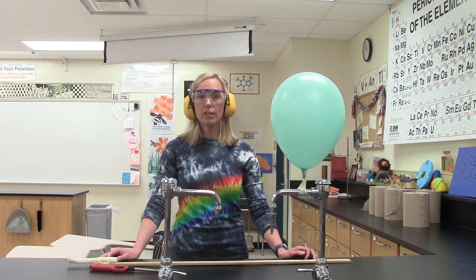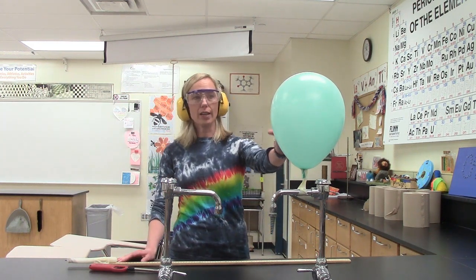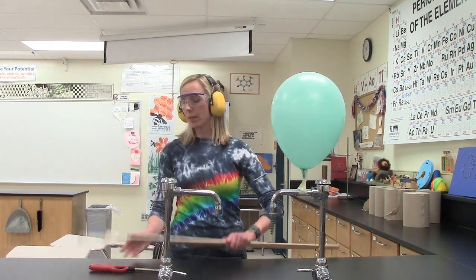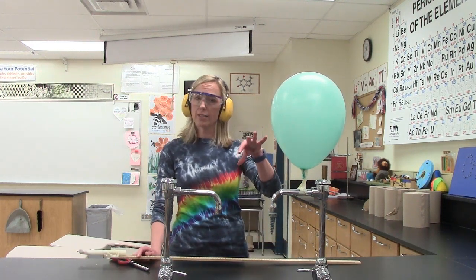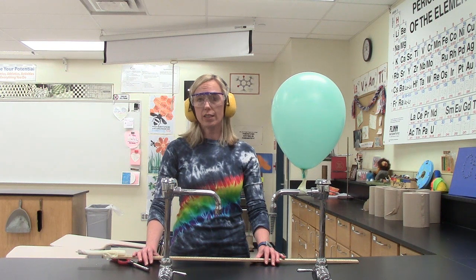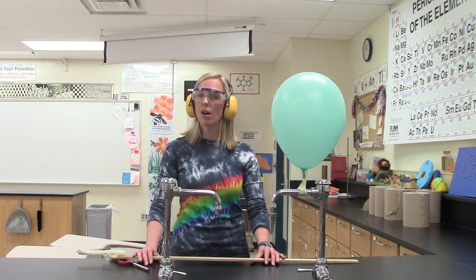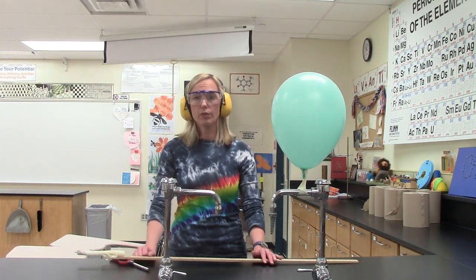Okay, so we're back in the lab, and as you can tell, I've got some ear protection on. I've got my hydrogen gas and oxygen gas now in the balloon. I'm going to take a lit candle and I'm going to touch the surface of the balloon. Right now the gases inside of there, they're colliding with each other, but the chemical reaction has not begun. We need to give it some extra kinetic energy so that those particles hit each other really hard so that the bonds can break open and new bonds can form.